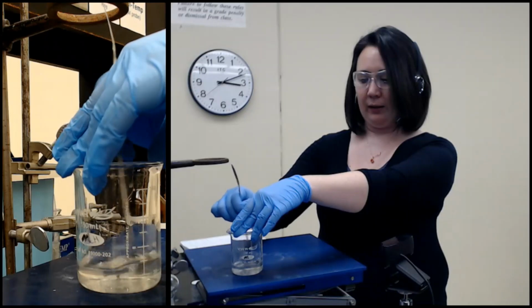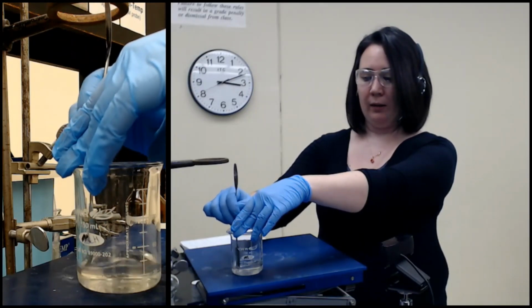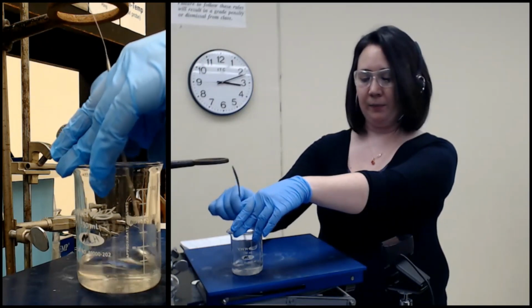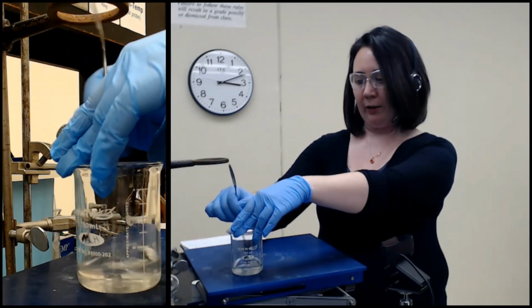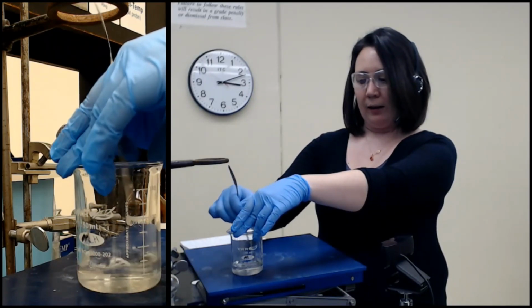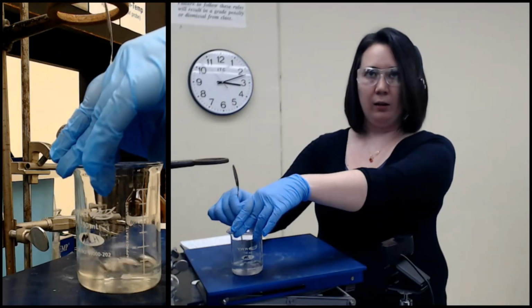Of course, things fall apart if you've got differences. If they all dissolved, we'd have to do other things. But right now, all I'm doing is stirring. And even though they are all 3 solids, they all have a slightly different look about them.